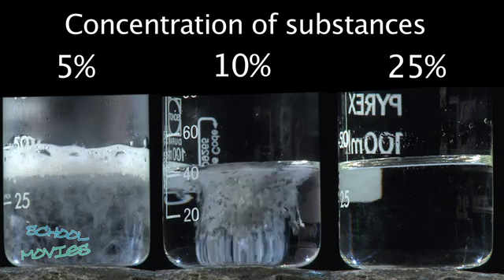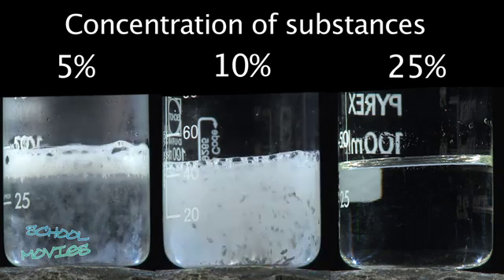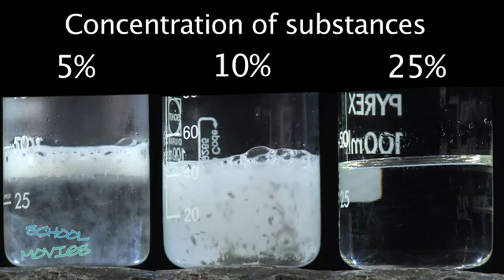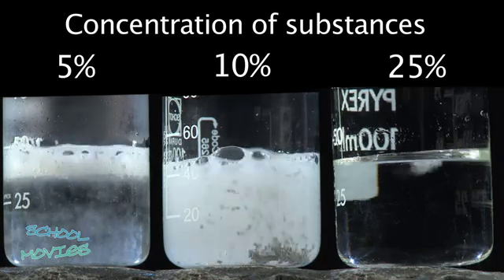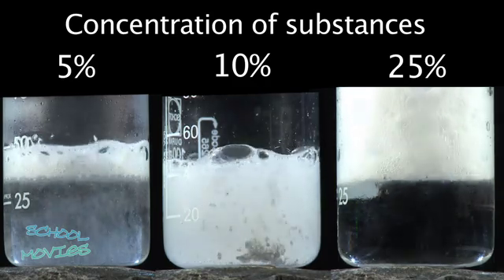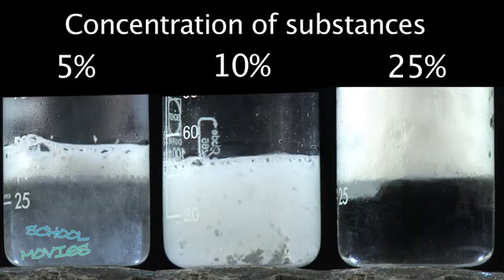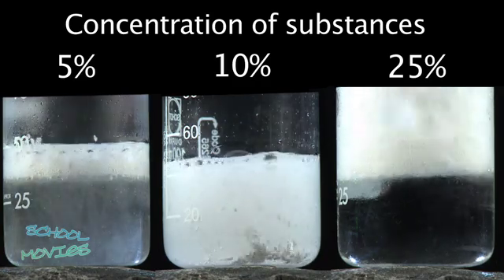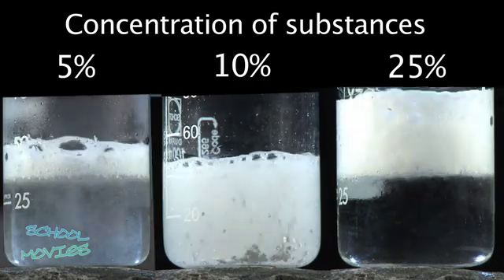In the second container, some gas formation can be observed. However, in the container with the highest concentration of hydrochloric acid, the reaction starts immediately. The higher the concentration of the reactants involved, the faster the reaction begins.